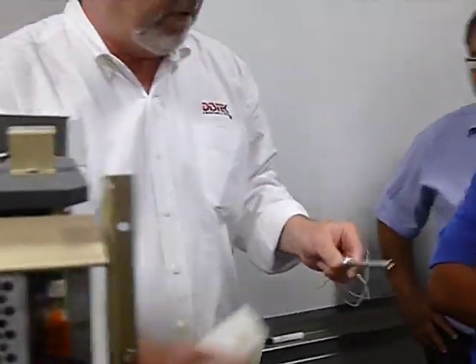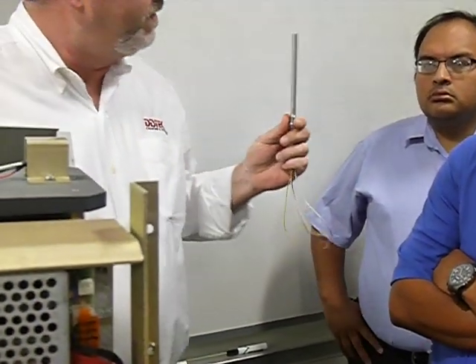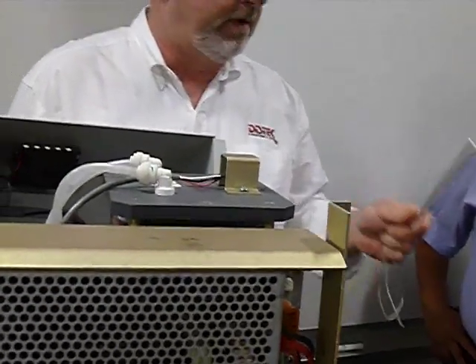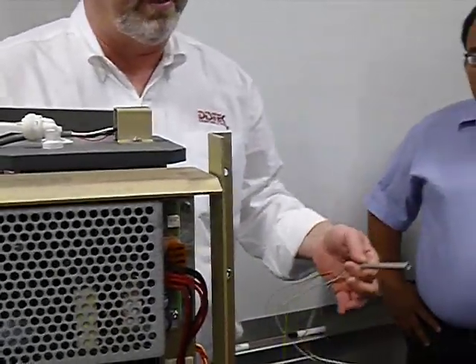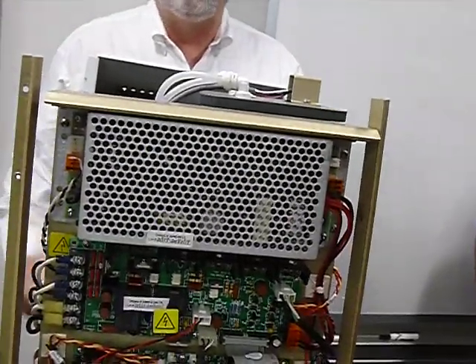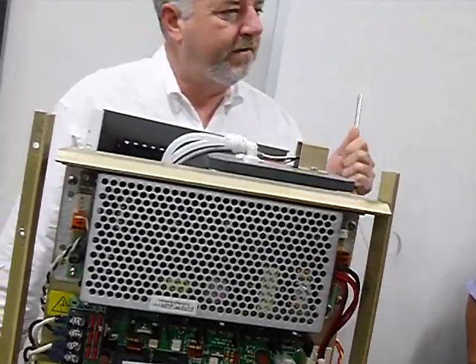And these do go bad every once in a while. The heater will blow out right around here. Now, there's 2 types of heaters. There's one for 110, and there's one for 240. So you want to make sure if you have 240 or 110. You're 110 down there, right? Yep. You're 240 in Saudi Arabia? 240. All right, so you need a different heater. Make sure you get the 240 heater. All right?